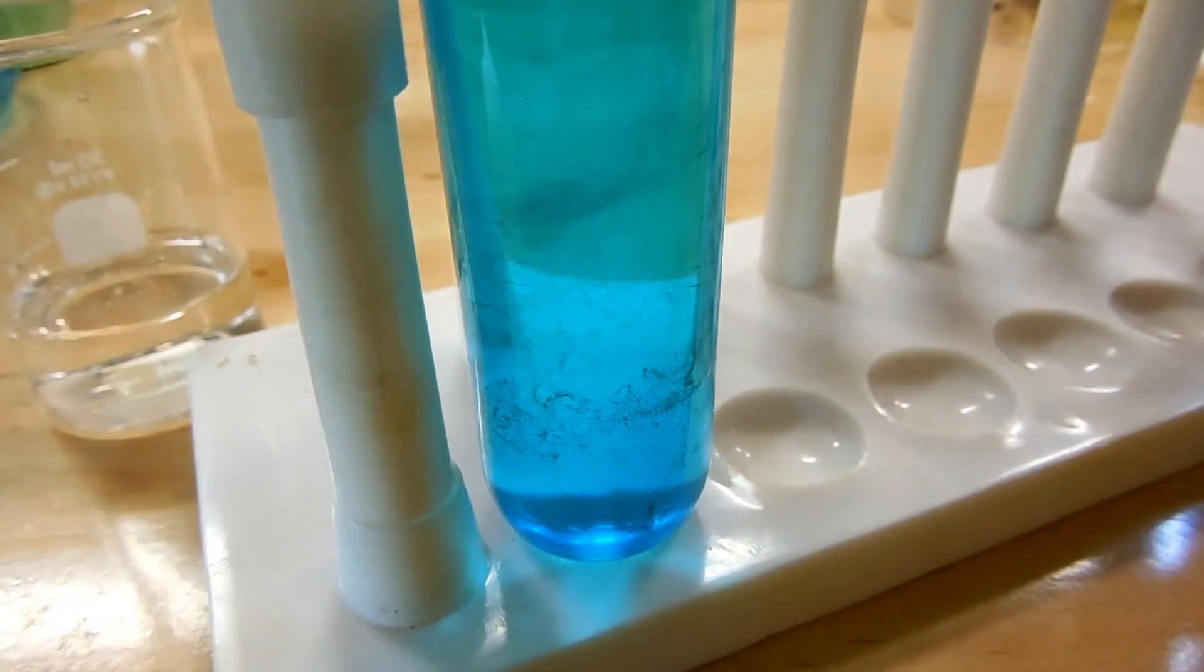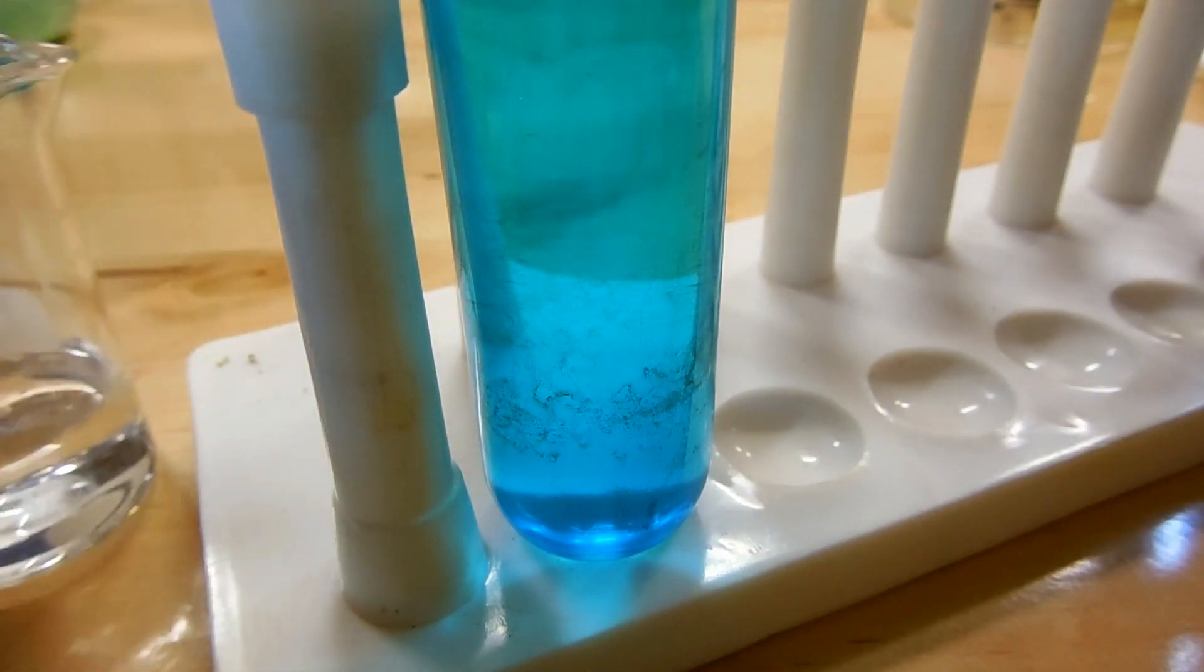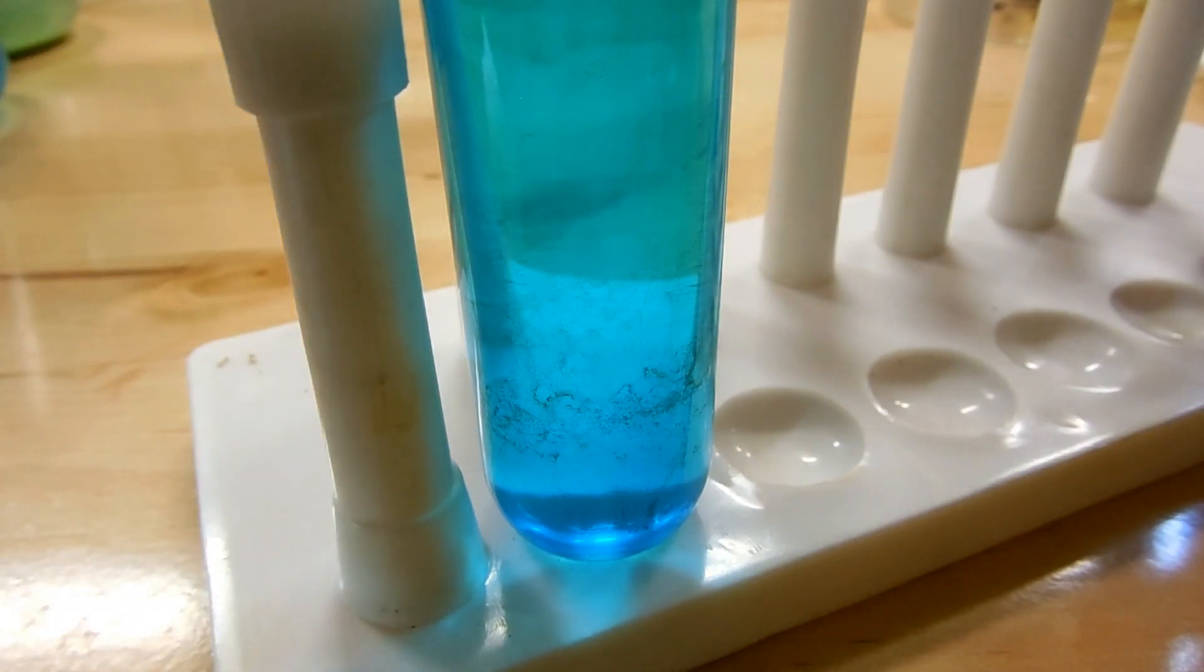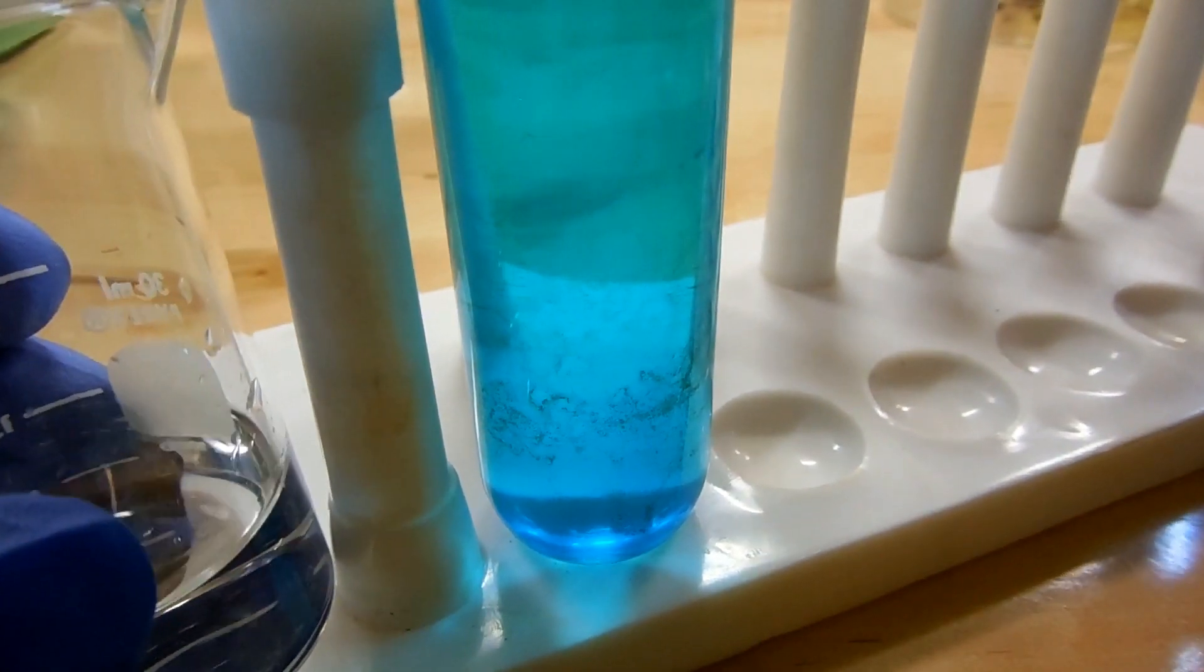And now we're going to add the solution of sodium metabisulfite. Now metabisulfite solutions smell very slightly of sulfur dioxide, so you may want to do this outside if that is annoying to you. So here we go, we're just going to pour this into the solution.